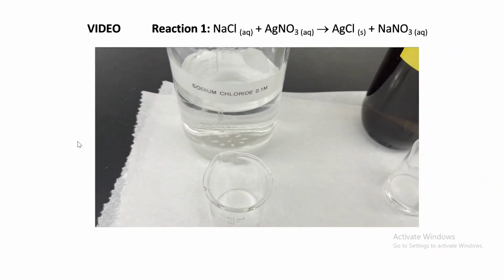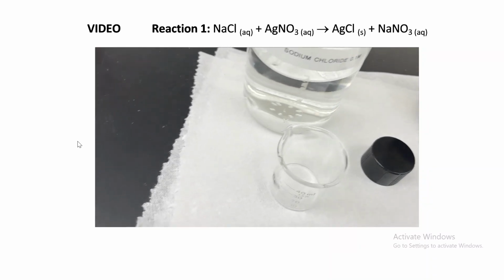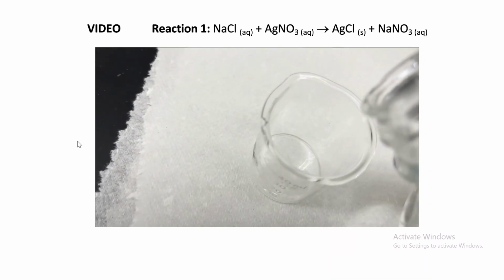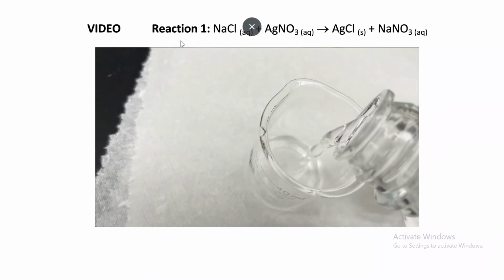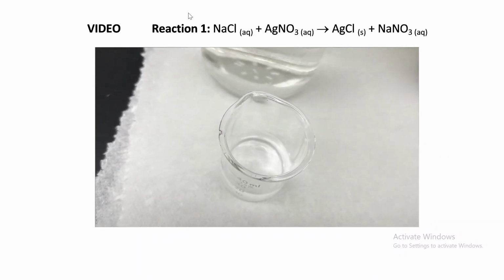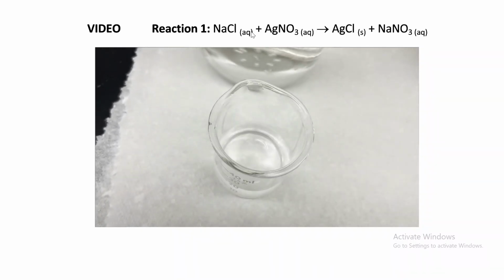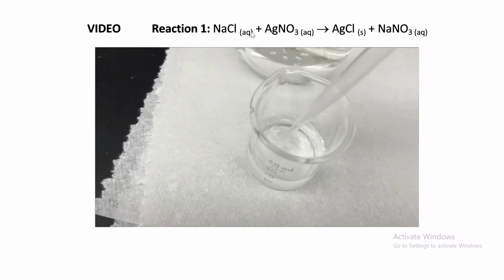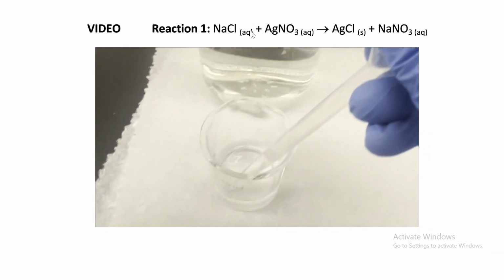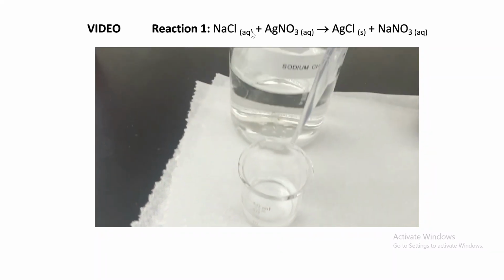Sodium chloride, it's also a colorless liquid, but it's in a clear bottle. We're going to pour a little bit of sodium chloride, which is NaCl. What is the state of matter? Notice it's a liquid. So we say aq because we know that it has NaCl, it has salt. So this is salt water. You're going to take a little bit of salt water, NaCl, using the disposable pipette.